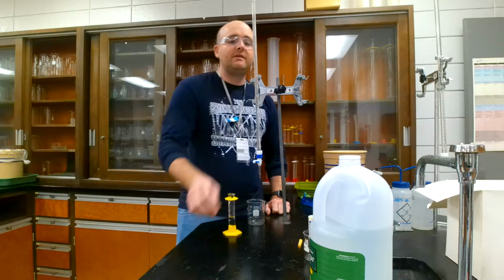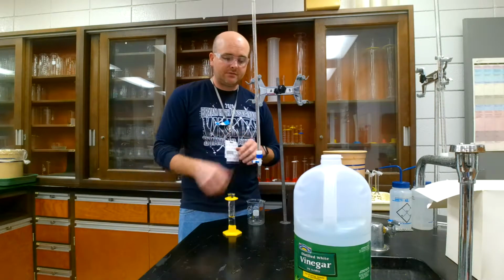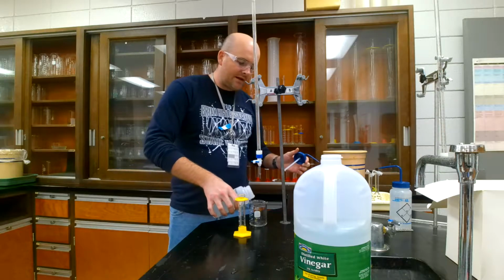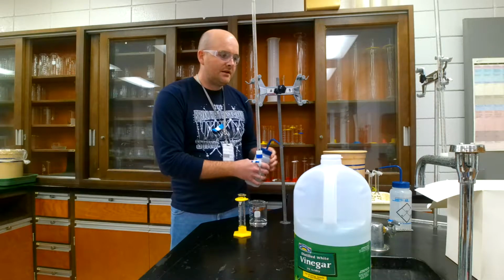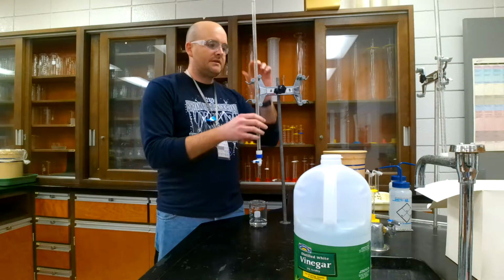This is actually going to be vinegar. I'm just going to simulate what we would normally do a titration with. So this would be vinegar, and it's 15 milliliters. I'll add a little bit of water just to increase the volume. That is not going to change how acidic it is, though. It's not going to change the number of moles of vinegar that's in there. It will change the volume, but not the number of moles, and that's what I care about.